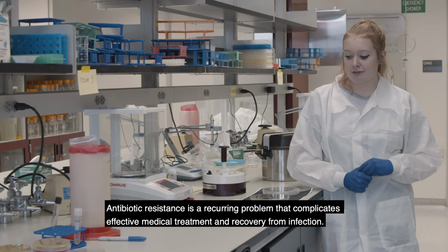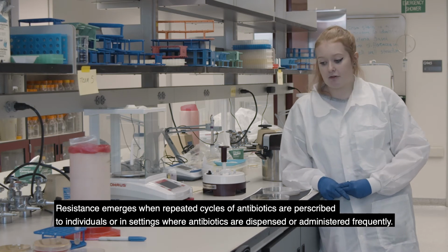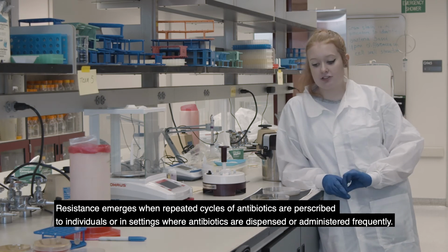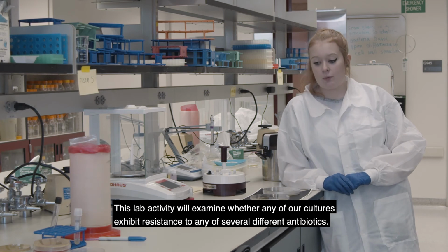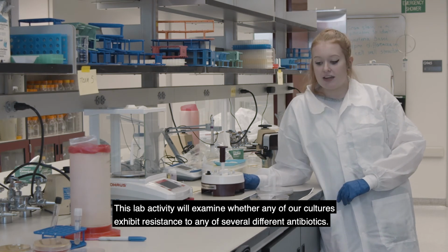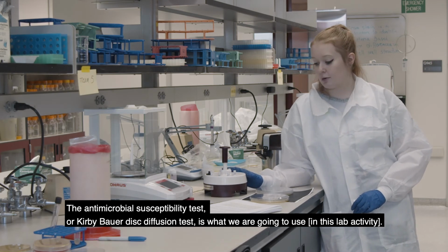Antibiotic resistance is a recurring problem that complicates effective medical treatment and recovery from infection. Resistance emerges when repeated cycles of antibiotics are prescribed to individuals or in settings where antibiotics are dispensed or administered frequently. This lab activity will examine whether any of our cultures exhibit resistance to any of several different antibiotics. The antimicrobial susceptibility test, or Kirby-Bauer disc diffusion test, is what we're going to use.